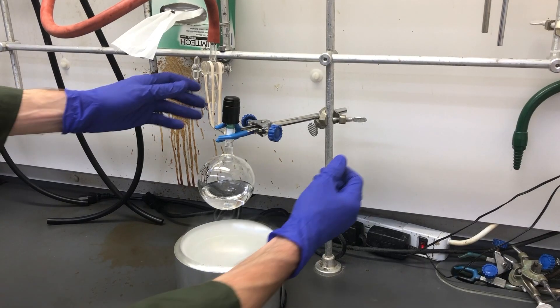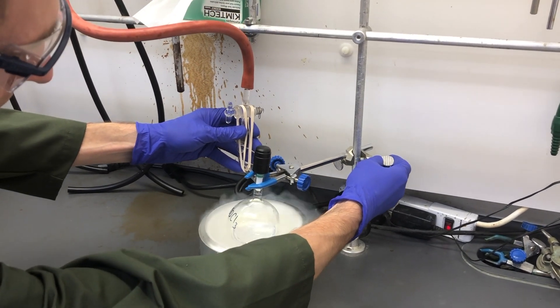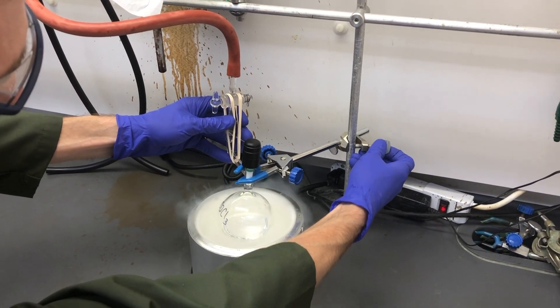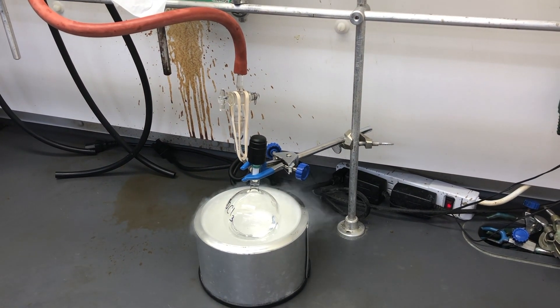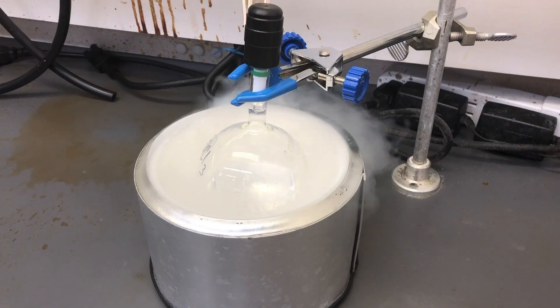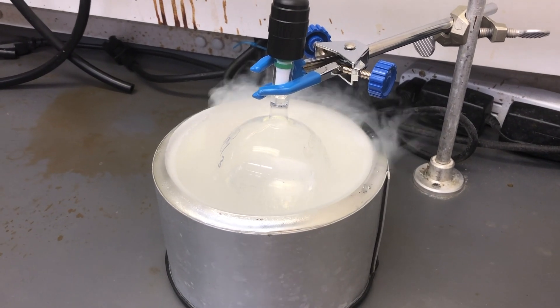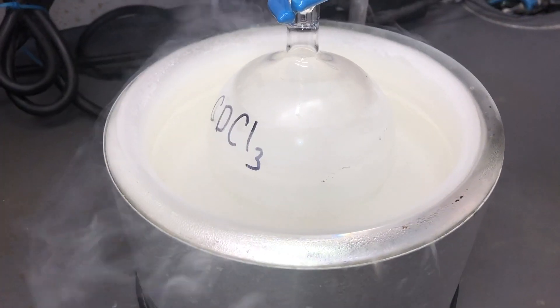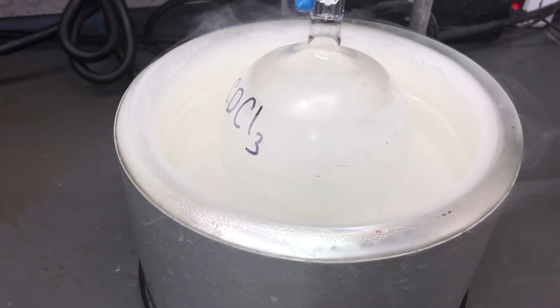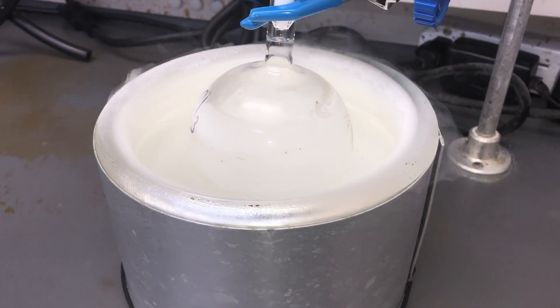It is now time to begin the actual freeze-pump-thaw. First, the freeze. Your flask is carefully immersed in the liquid nitrogen. Make sure to avoid having the flask or clamp touch the Dewar, as it is made of mirror glass and can be damaged easily. Monitor the level of liquid nitrogen as it will boil away as heat is removed and the liquid solidifies — add more as needed. Continue to peek into the flask; you need to be sure the liquid inside is completely frozen before proceeding.